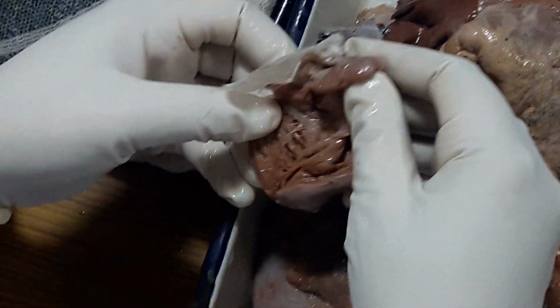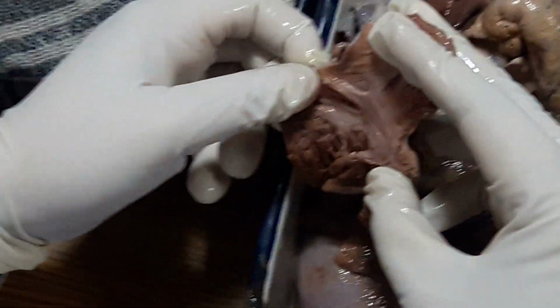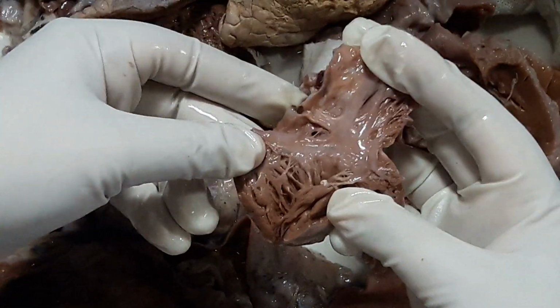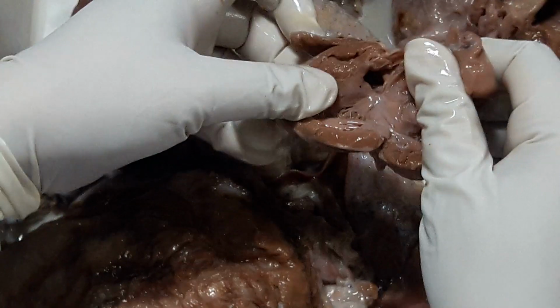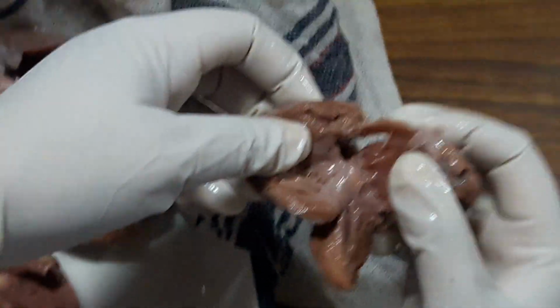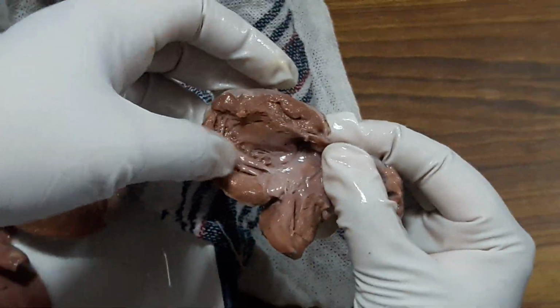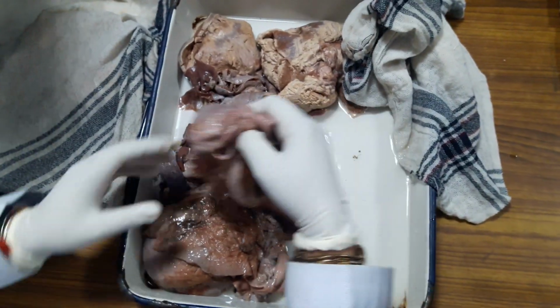Here what can you see? Right atrium, unremarkable. Right ventricle, pulmonary right ventricle, unremarkable. You come to the left side, there is a VSD. Oh, wow. In the membranous portion there is a VSD. This one. Ma'am, here, okay, this is the aorta, some part is cut, but there is a VSD. Okay.